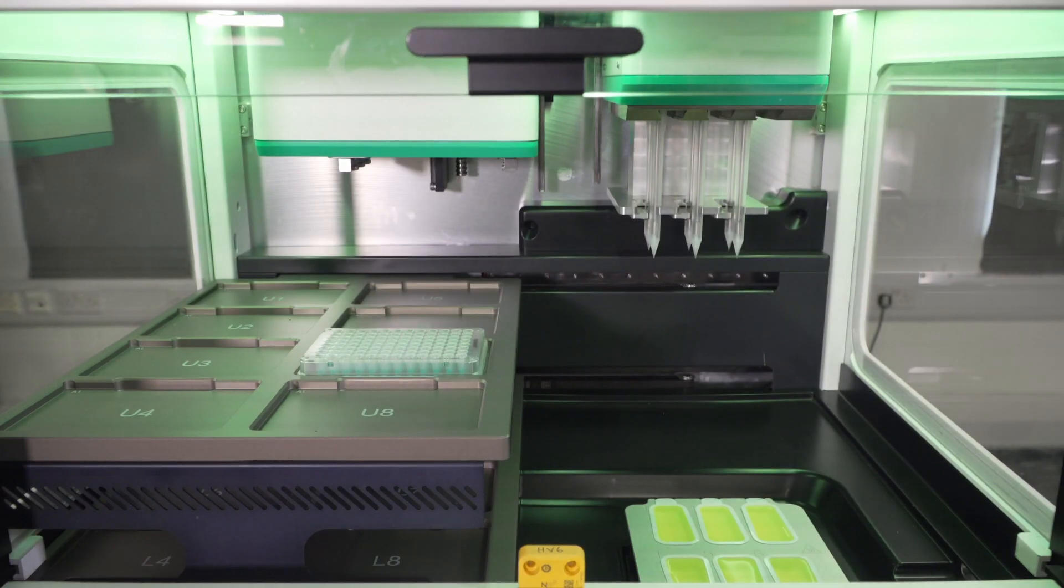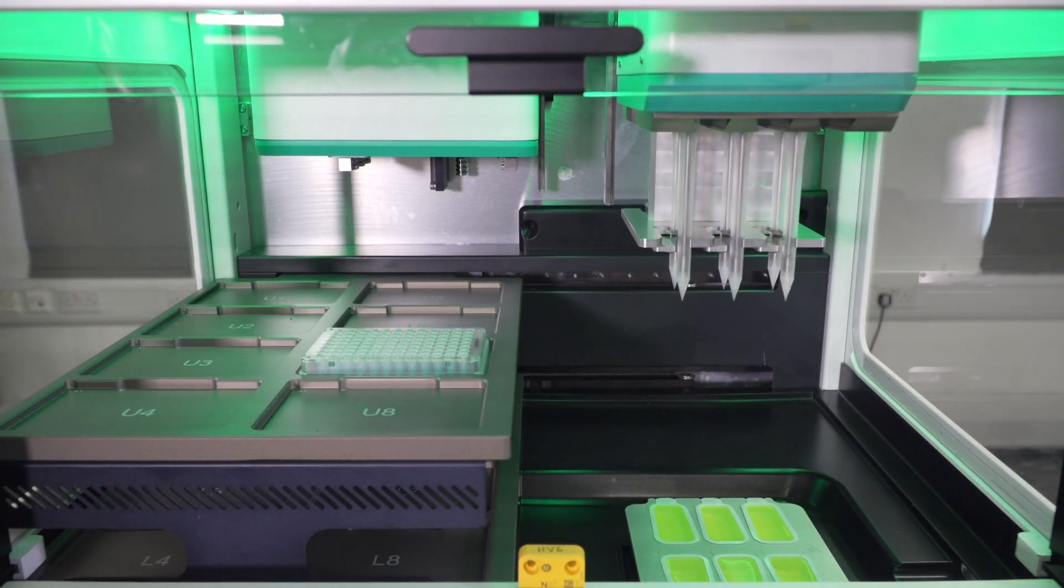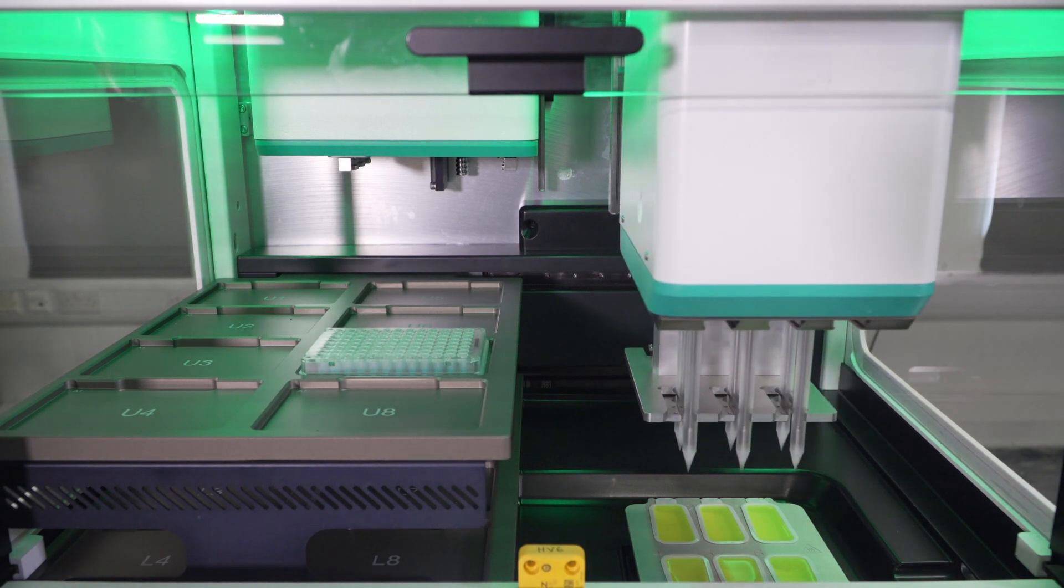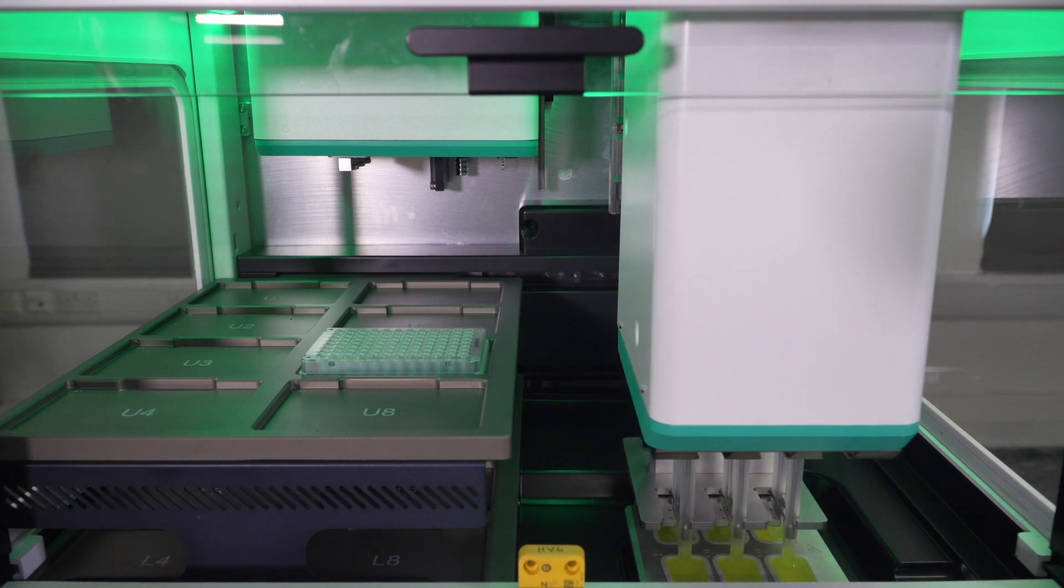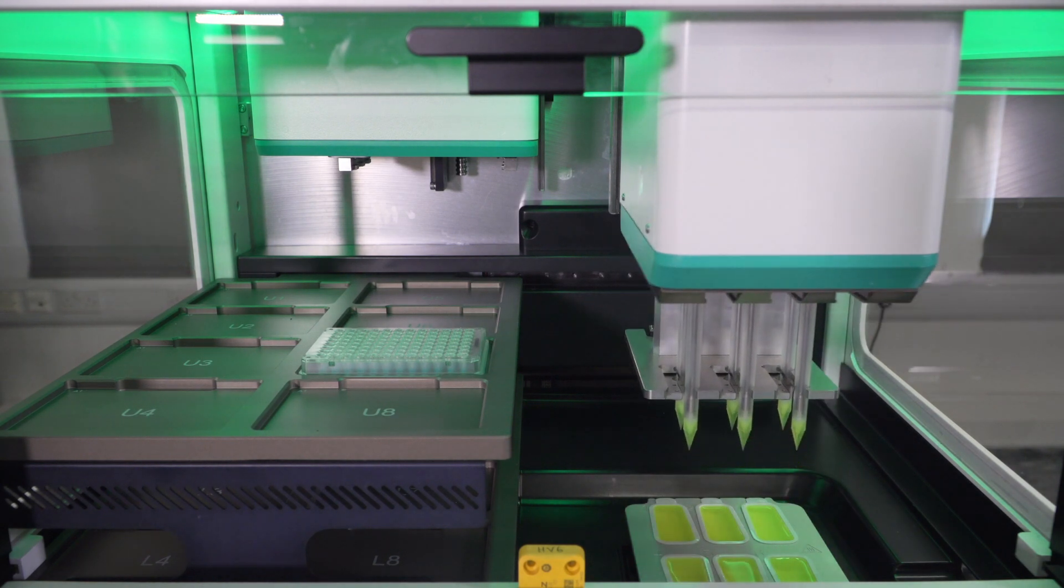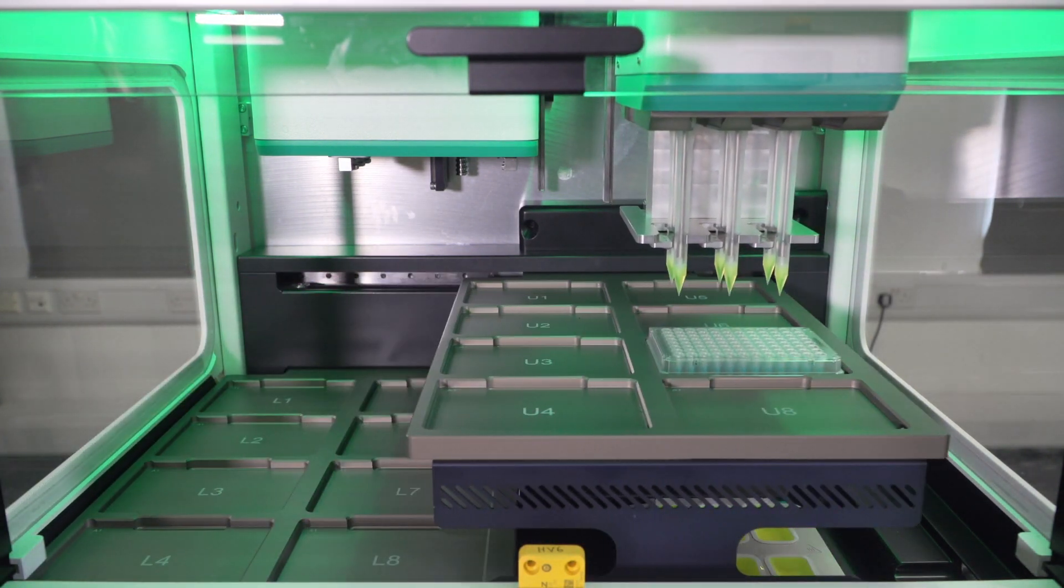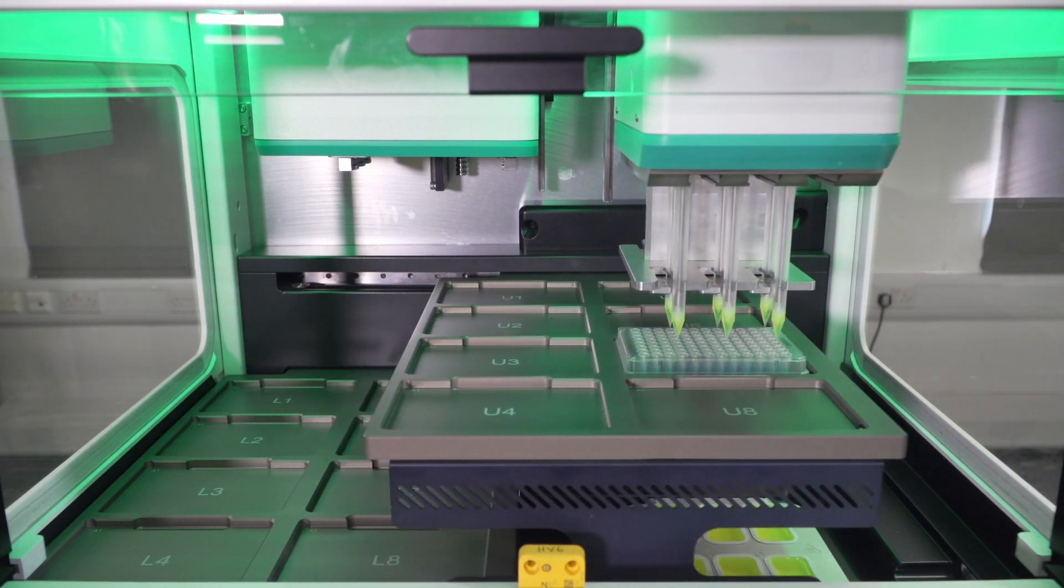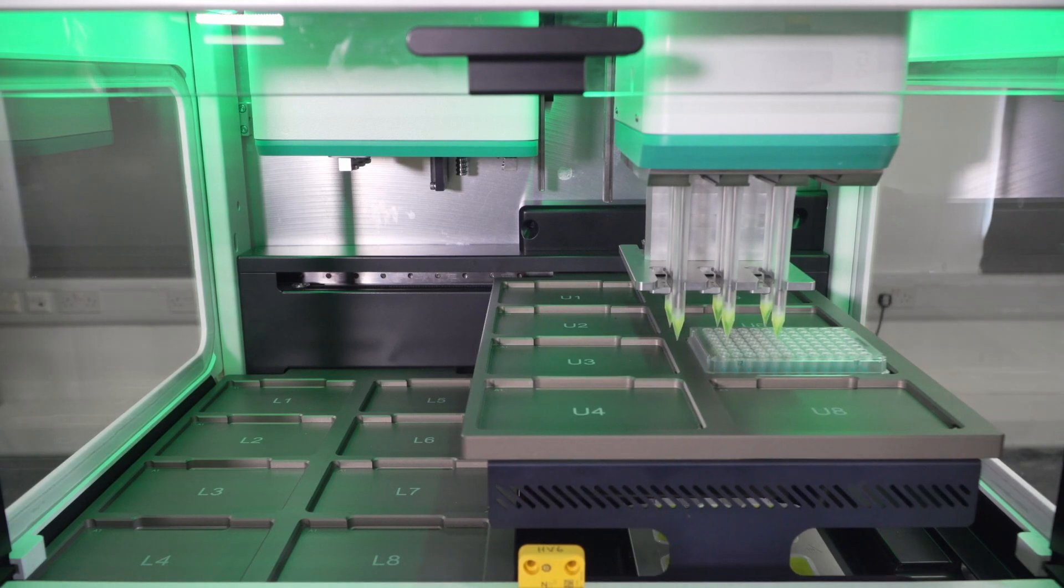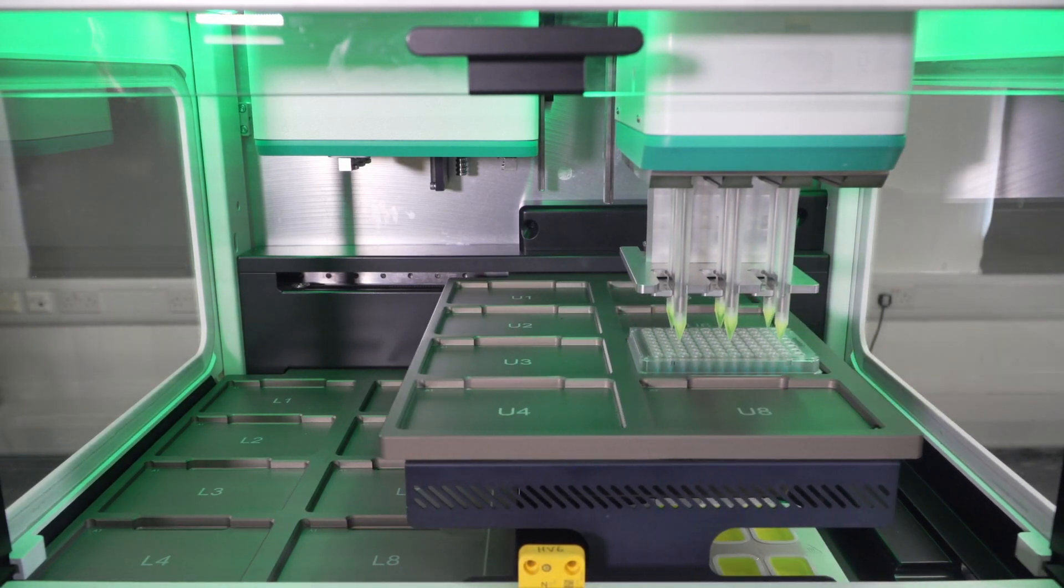I'm now going to execute the normalization run by pressing play. During this normalization, as it is a demo, we will be starting with a standard concentration of sample, which are represented by the blue ink in our plate on deck. And the dispense head has just aspirated a bit of liquid from the reservoirs, which is colored yellow.